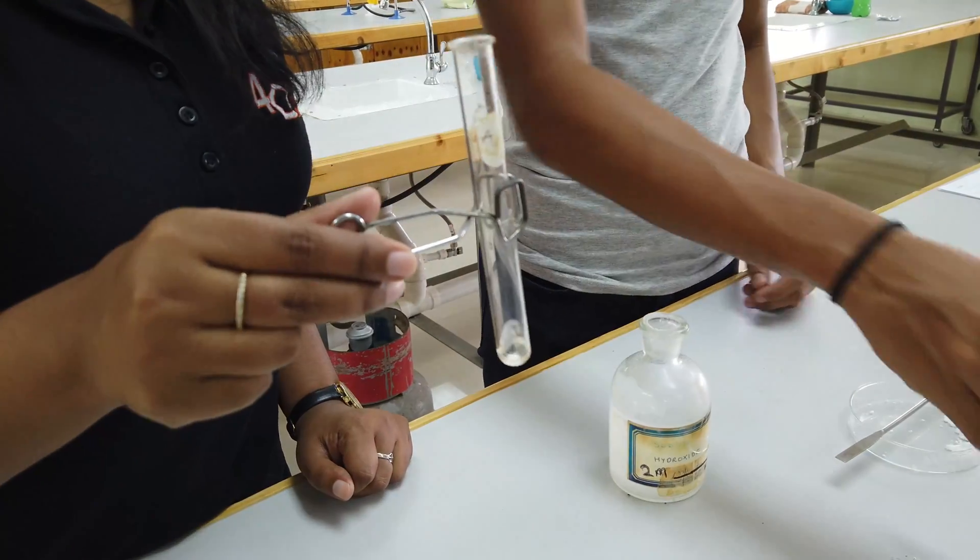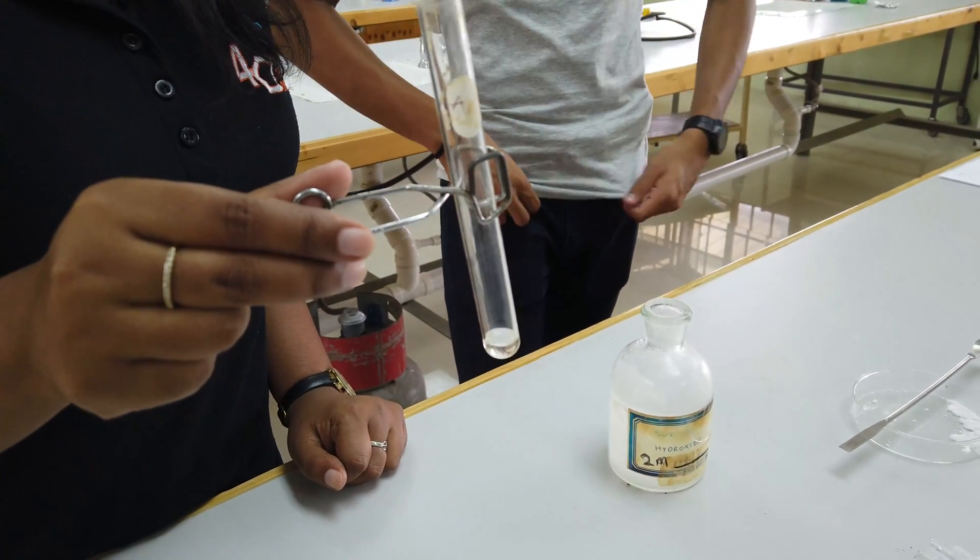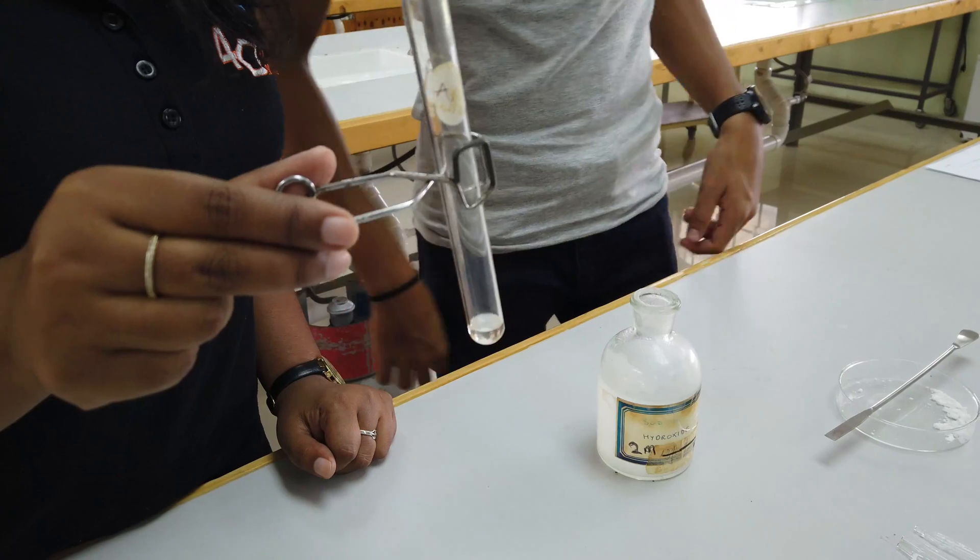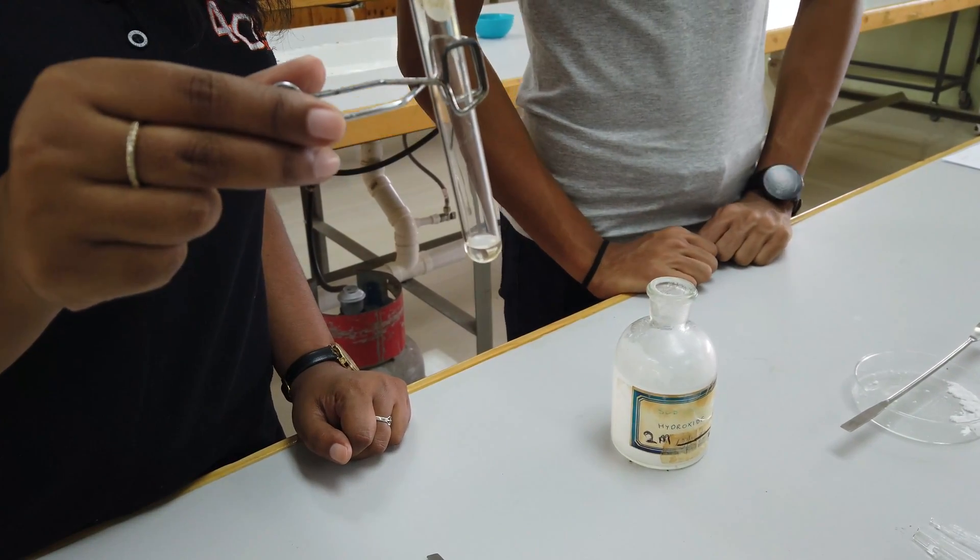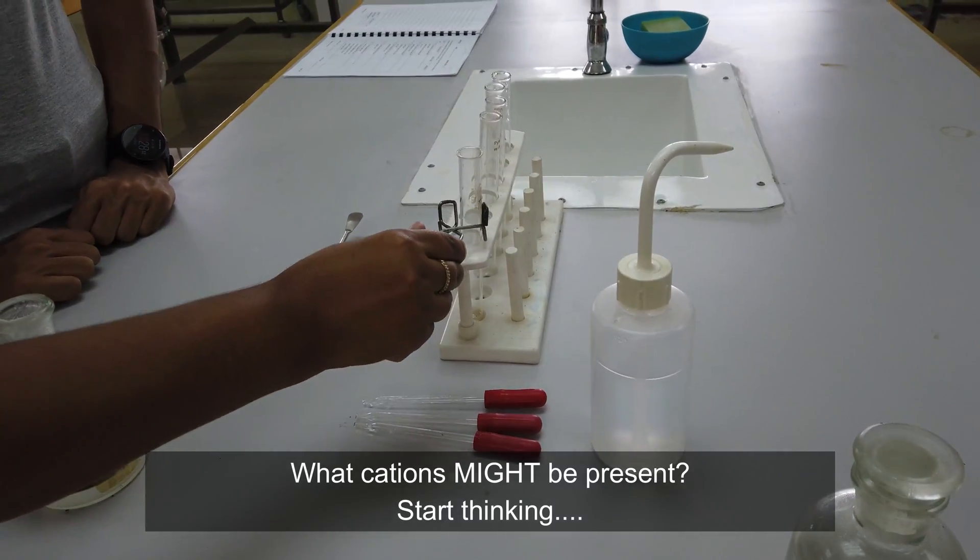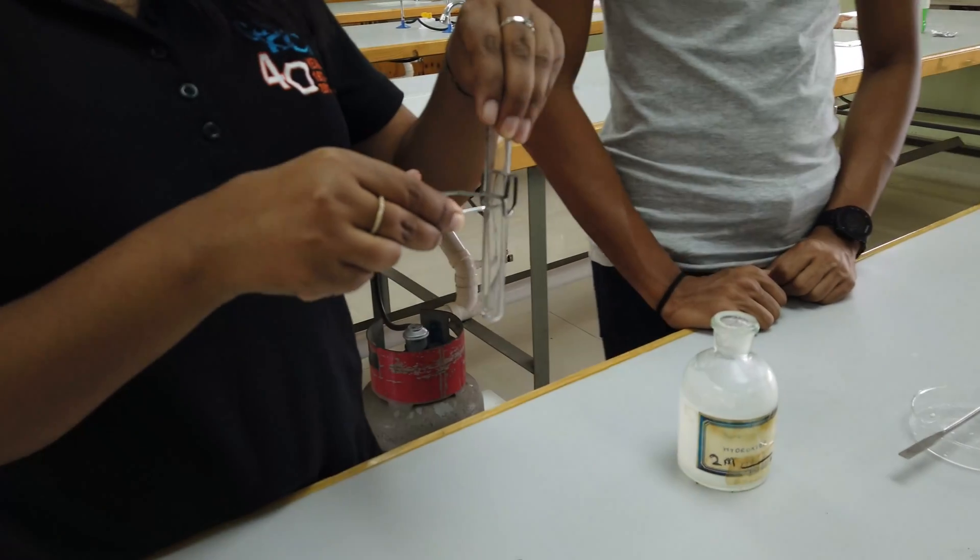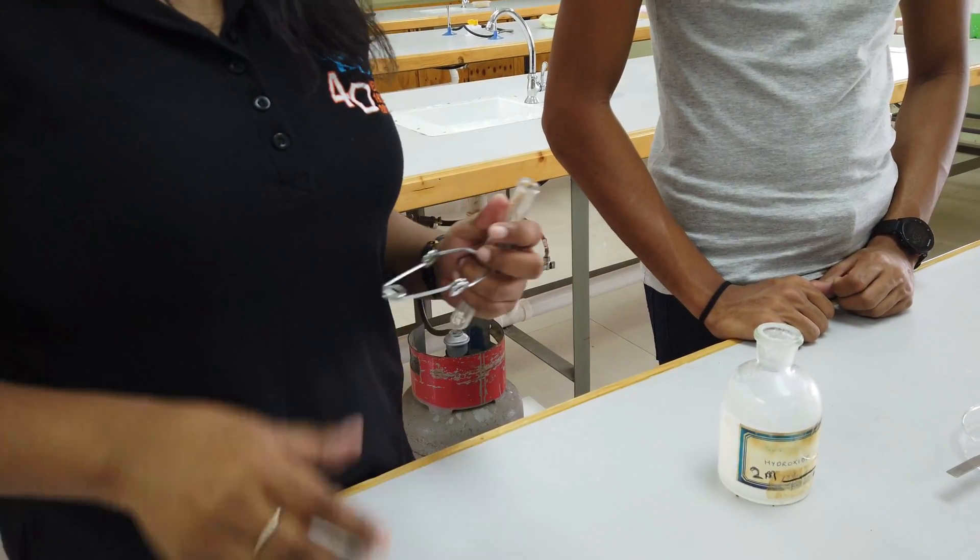I know that not all of the salt dissolved, but some dissolved because what we have at the end is a little less than what we started with. White precipitate soluble in excess. Test tube two - little bit of salt again.